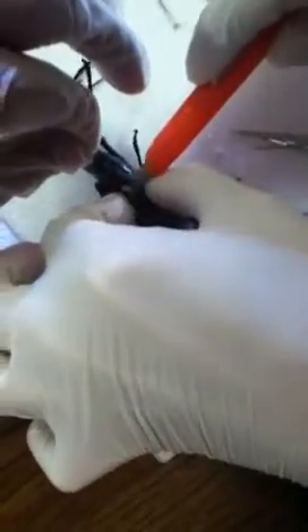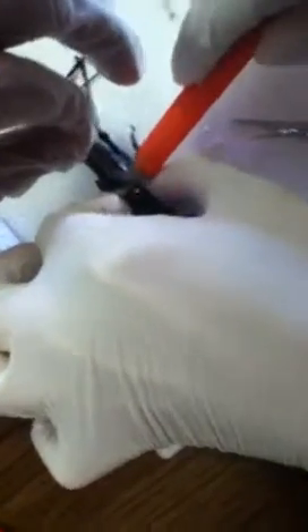Dude, it's like — you hear that? Gross. The other one though? Yeah. Do we get these little ones too? Yeah, you have to cut off all the legs. Can we cut off the little ones in the front? Yes, legs — get rid of them.